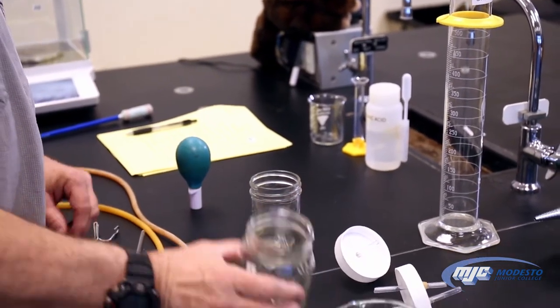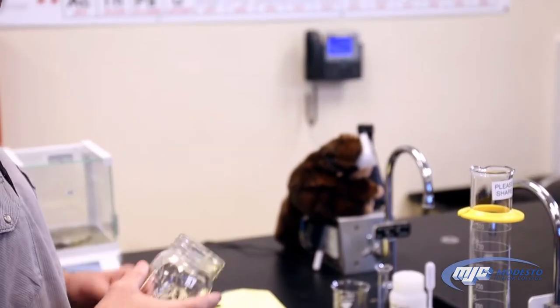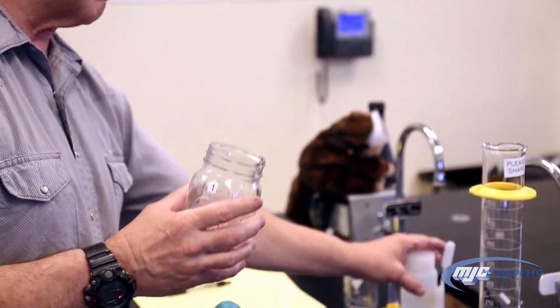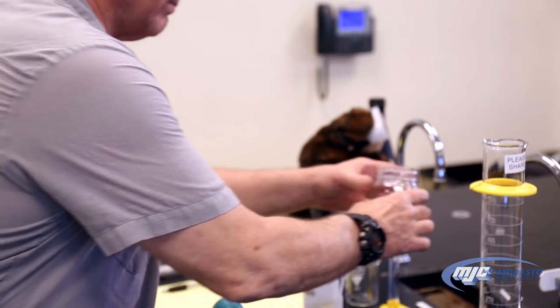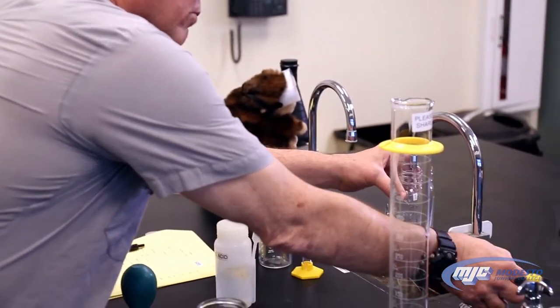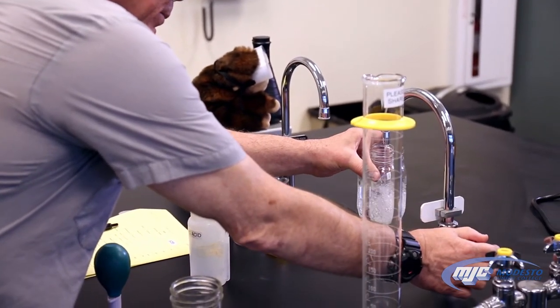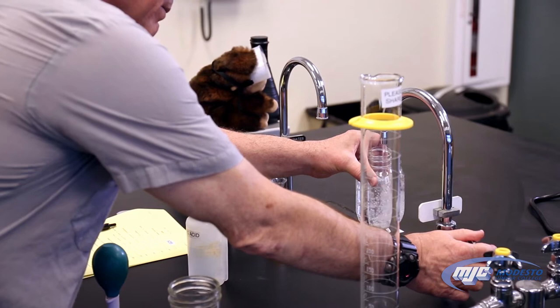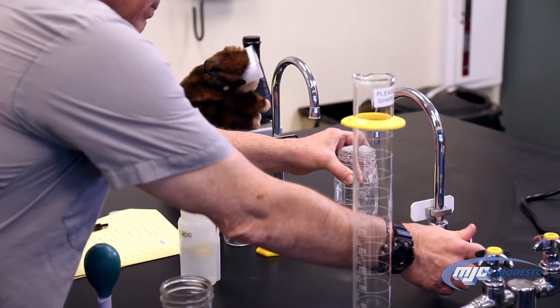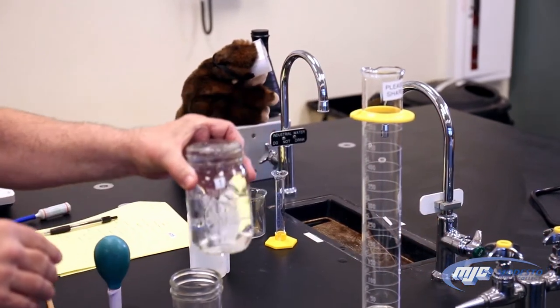Take the unknown in the cuvette and put it into the pint-sized mason jar, making sure not to spill any. Next, take the quart-sized mason jar and fill it all the way to the very top with regular tap water — we want to get as much water in here as we can. See how it's overflowing? That's pretty much what you want.